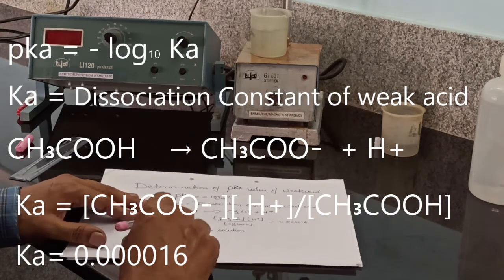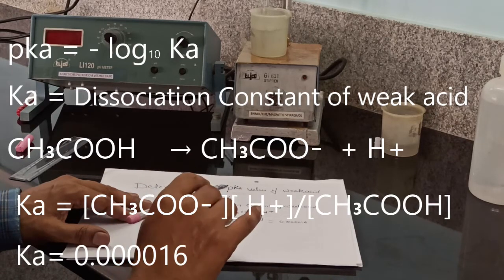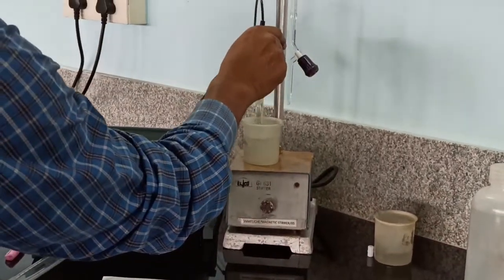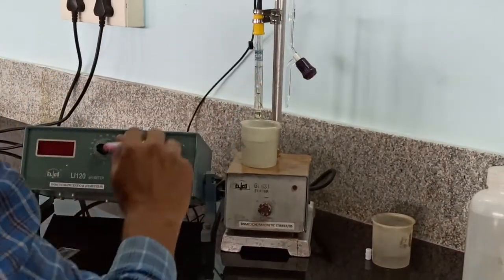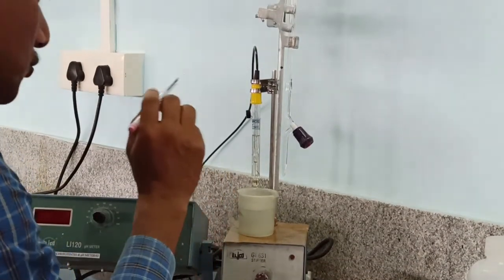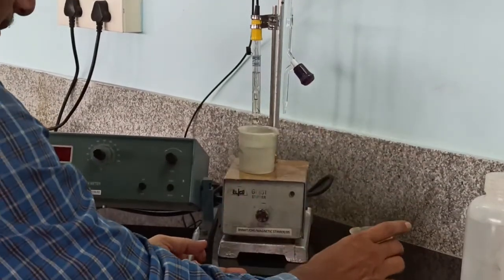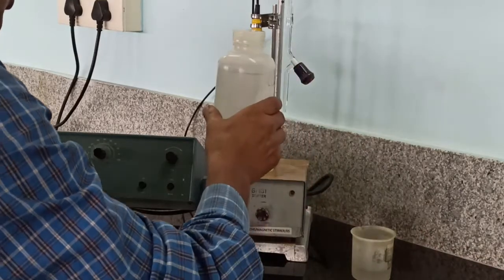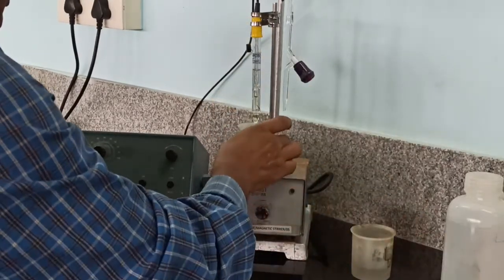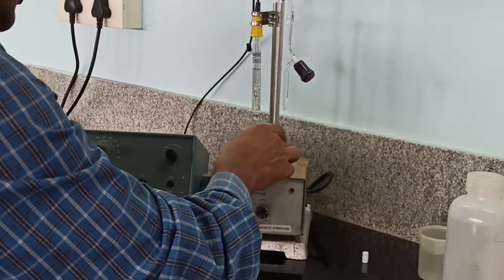The pH of the solution is measured with the help of an ion selective electrode, that is the glass electrode, and the reference electrode is the calomel electrode. Here you have to use this combined electrode. A combined electrode is a combination of glass and calomel electrodes. We will provide the weak acid in a 100 ml beaker. First, wash this electrode with distilled water. Then immerse this combined electrode into your weak acid solution.